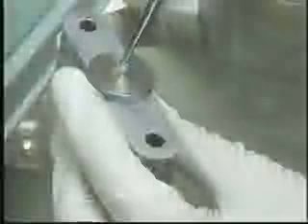The cryoEMBEDDER technique enhances the quality of surgical biopsies, needle biopsies, punch biopsies, and all dermatology specimens. The cryoEMBEDDER is the fastest procedure available. It's efficient, convenient, and it produces a much higher quality slide.